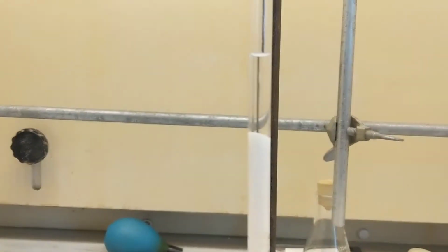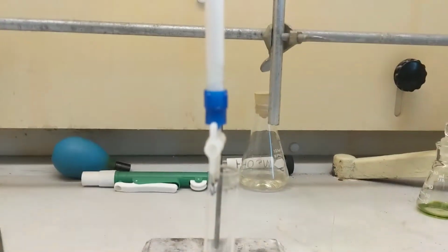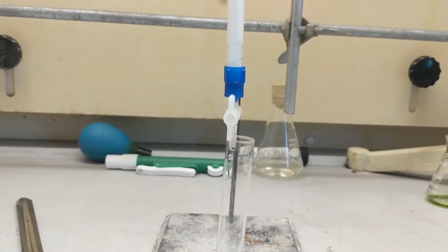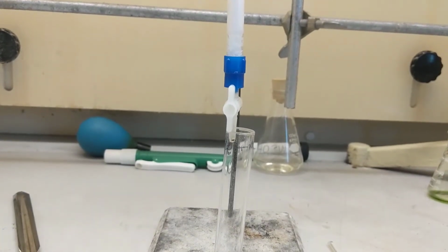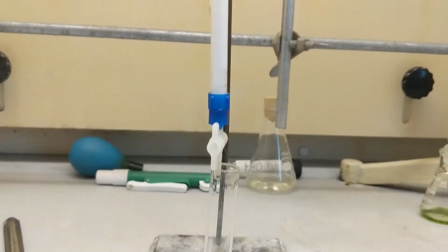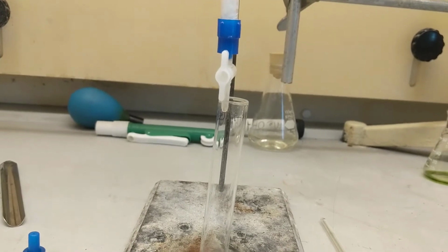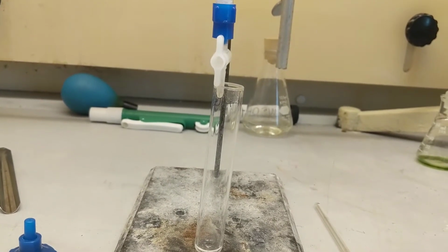Alright guys, right now I'm running my hexane through my column. I think I made a mistake. Well, not a mistake, just an error. Like, I won't have to start over or anything, but if you can see, the rate of drops is so slow. And that's probably because I made my cotton plug at the bottom too tight. So it won't affect you guys. You'll get your results all the same, but I will be here for a while.